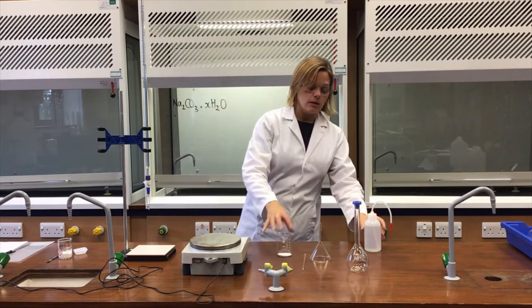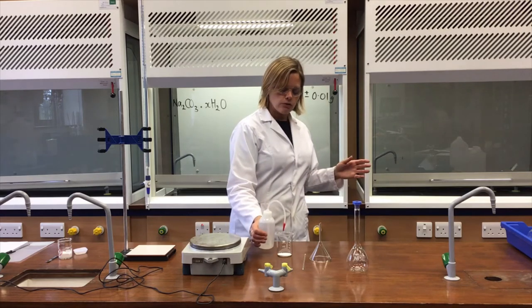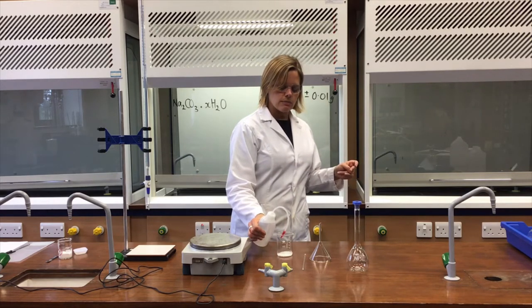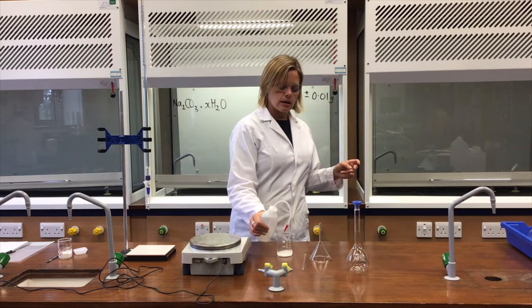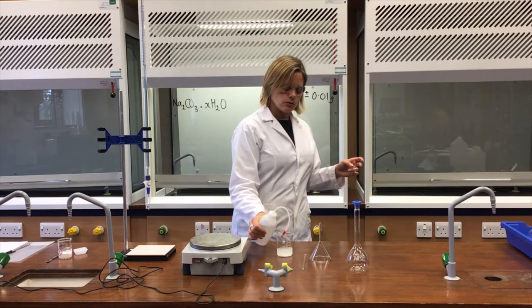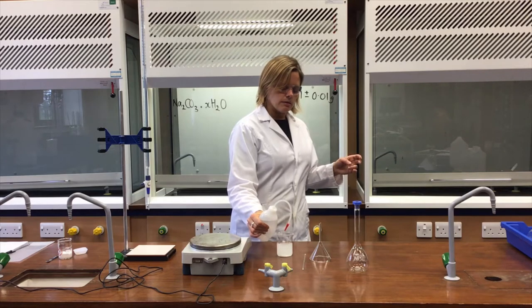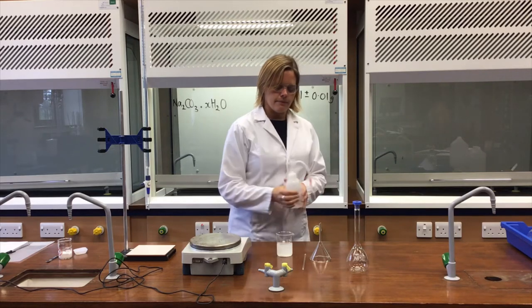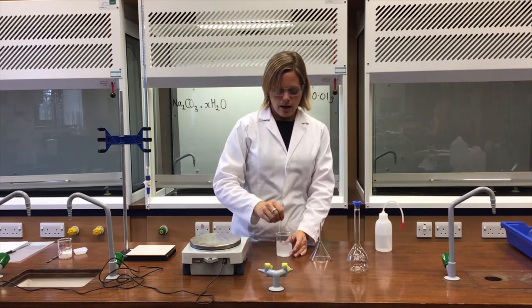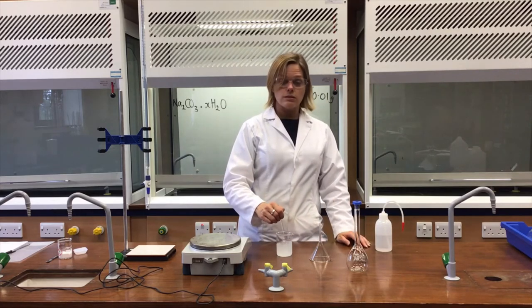Step two: I take the solid and add approximately 100 cm³ of distilled water to the beaker. Then I use a stirring rod to stir until all of the solid has dissolved.